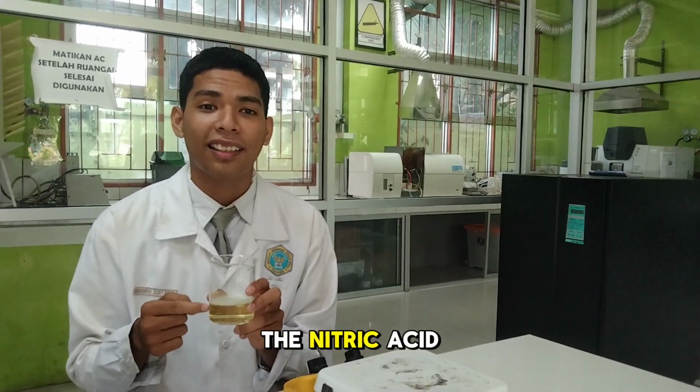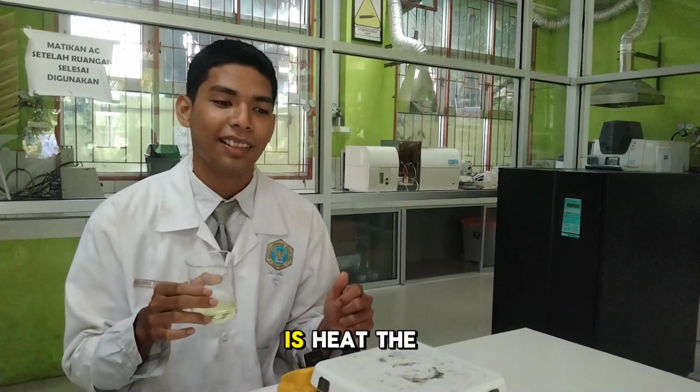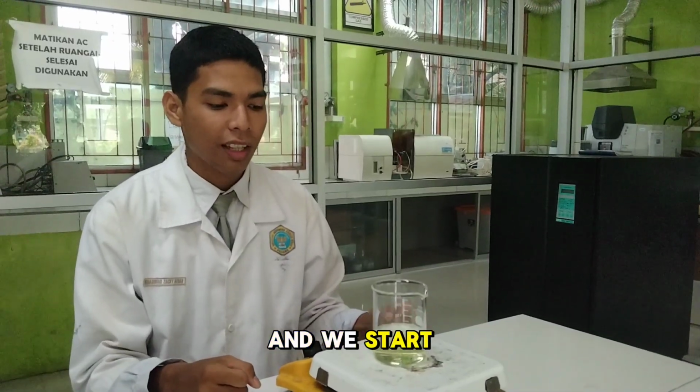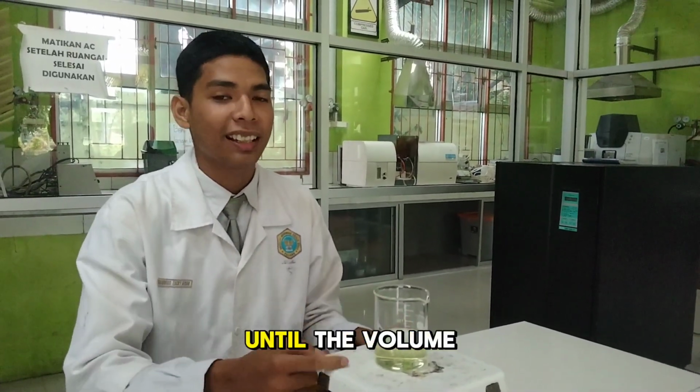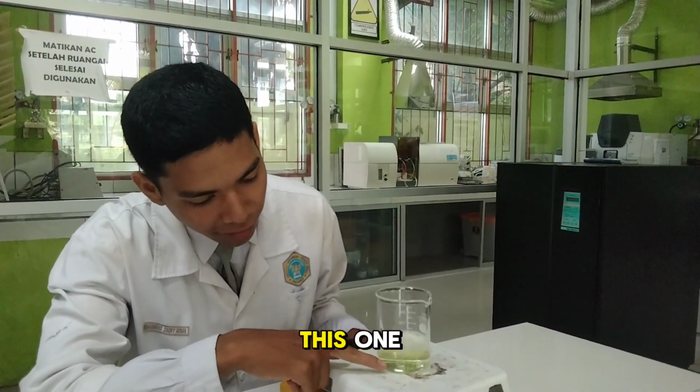After we add the nitric acid, the next step is to heat the sample on the hot plate. We start the hot plate and wait until the volume of the sample is 1/3, like this one.